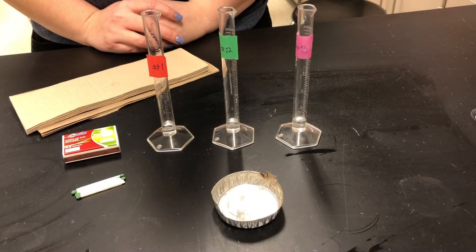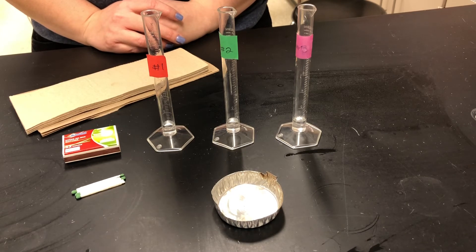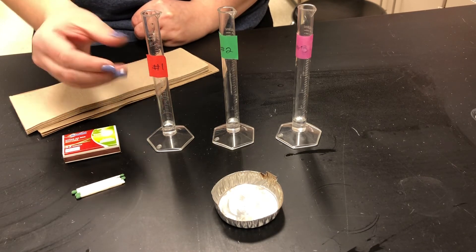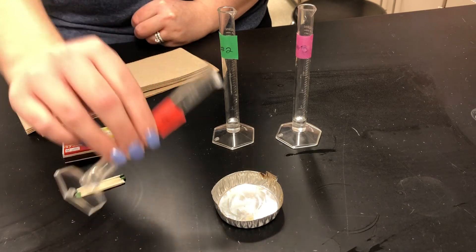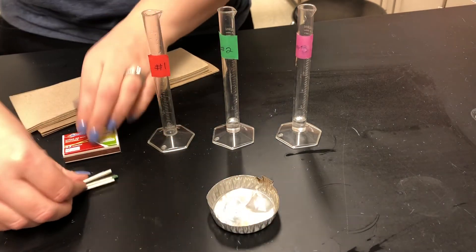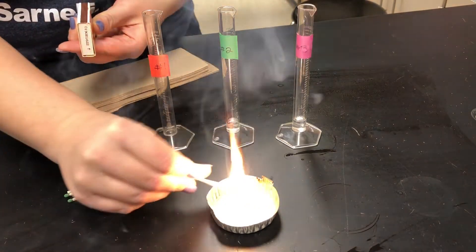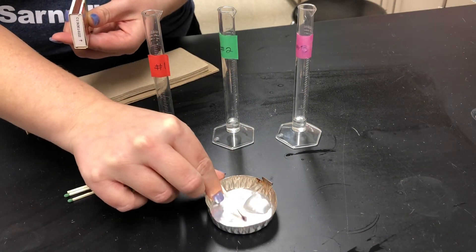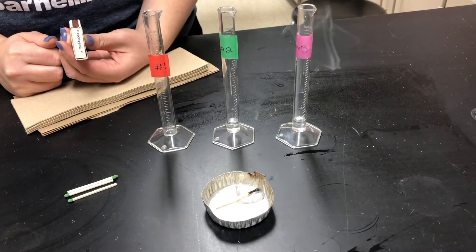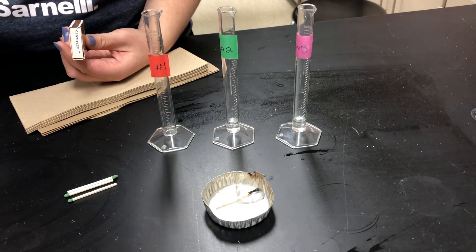We will now perform the flammability test of each of the unknown liquids. We will start with liquid number one. With one milliliter of the liquid, we are going to pour it into our aluminum cup. We will then light the match, place the match in the aluminum cup, and as you can see, the flame is extinguished once it is placed in the liquid.